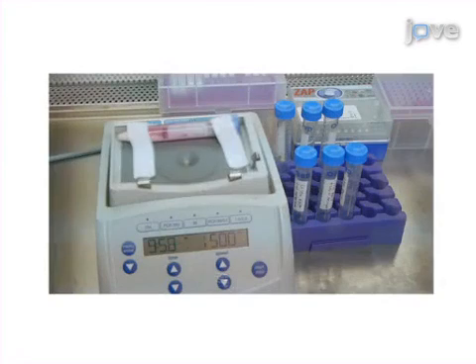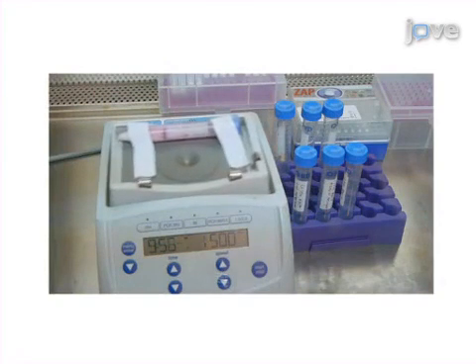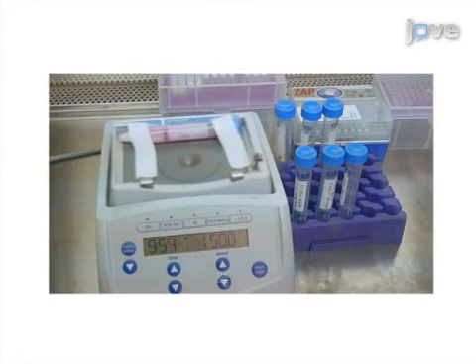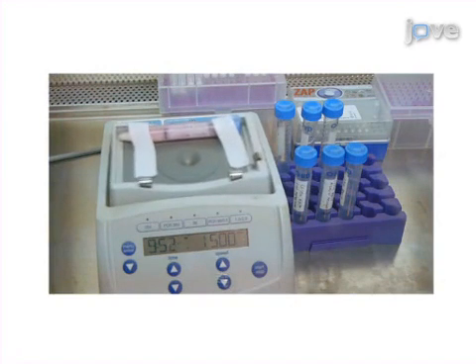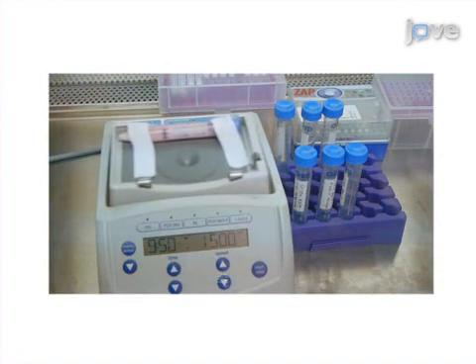Next, the metatranscriptome tube is sealed, placed horizontally, and the sputum homogenized at medium speed for 10 minutes.